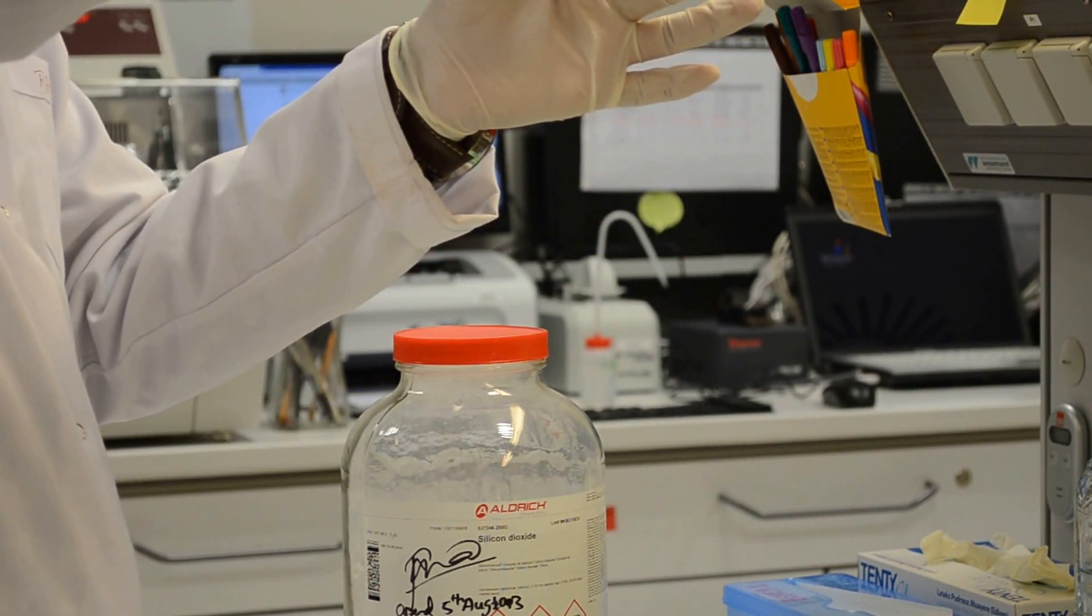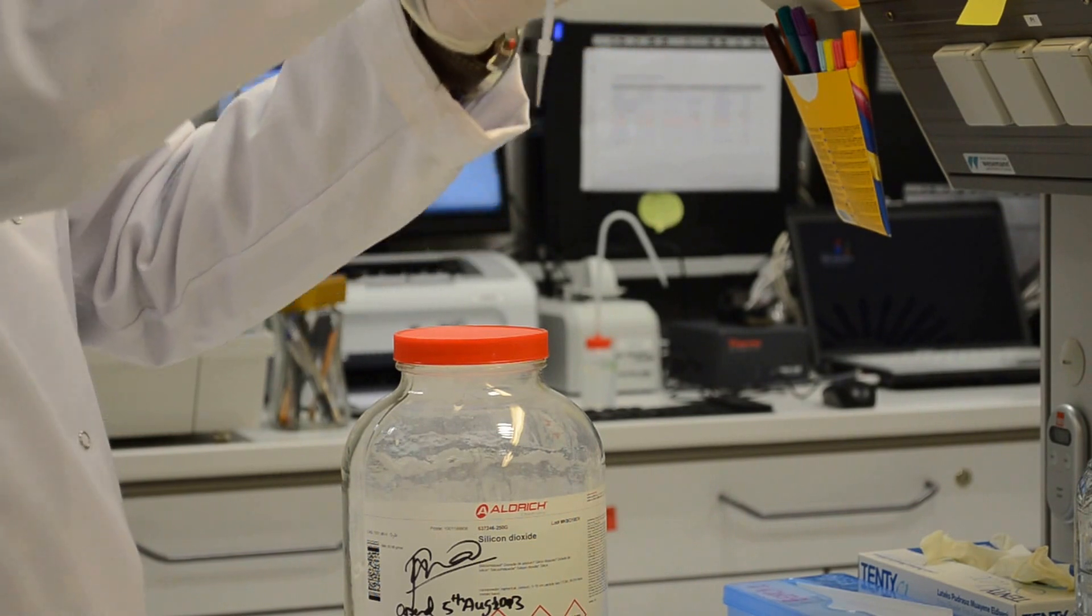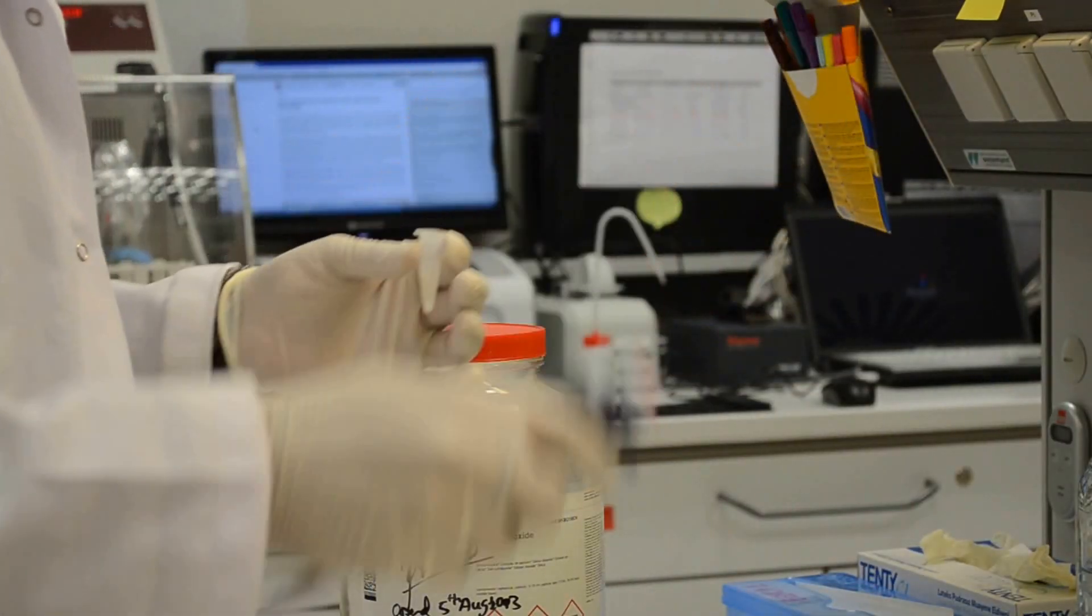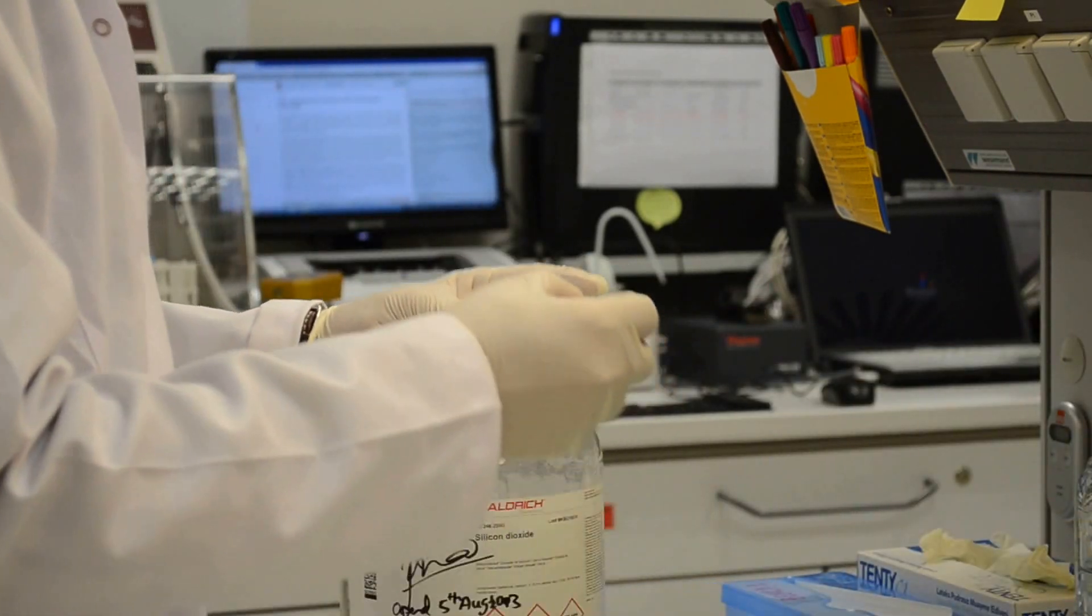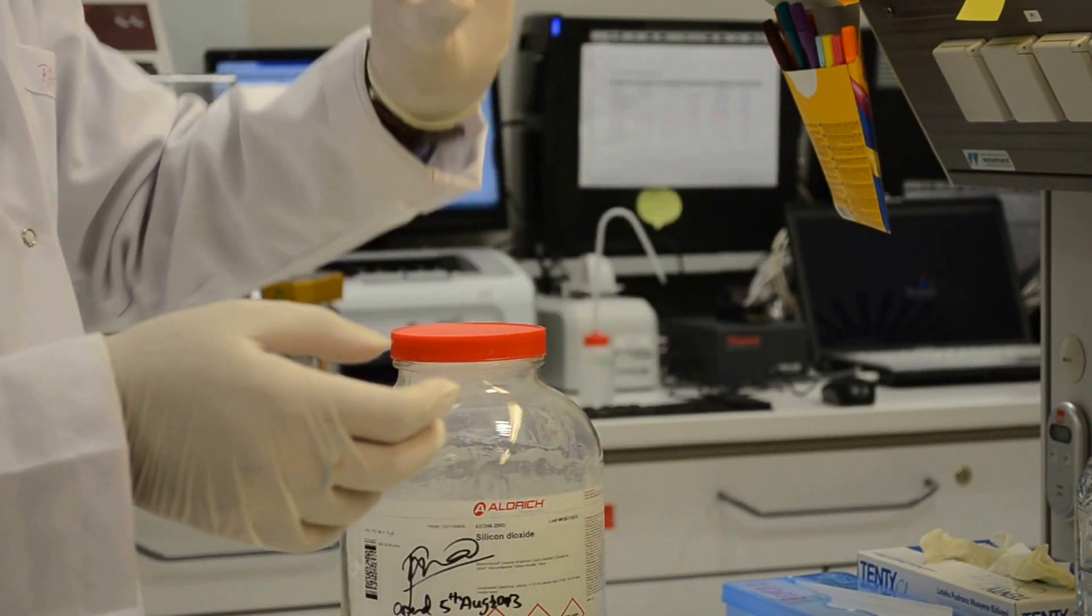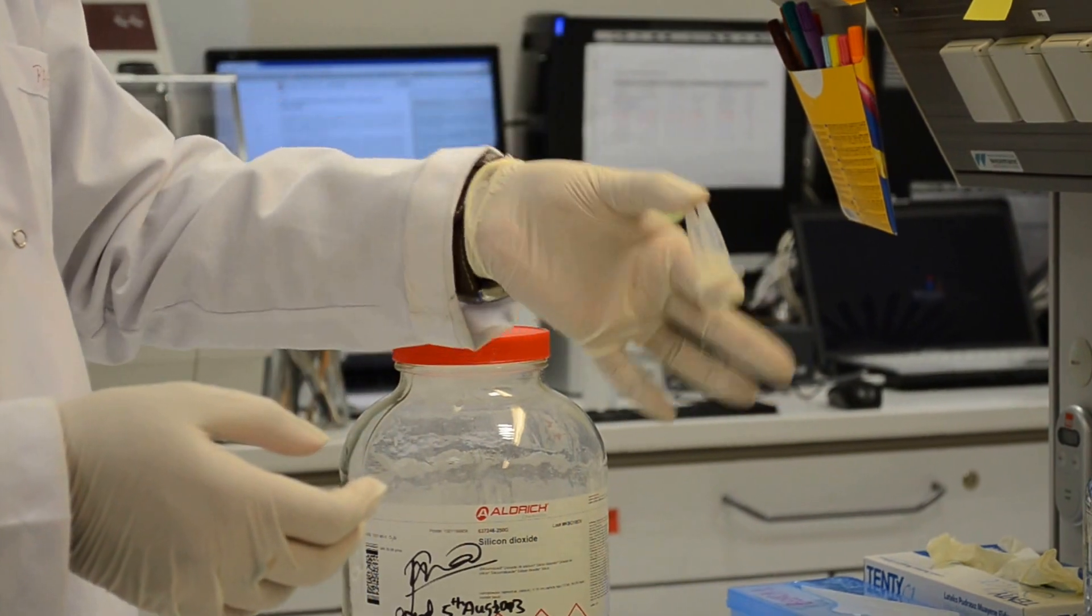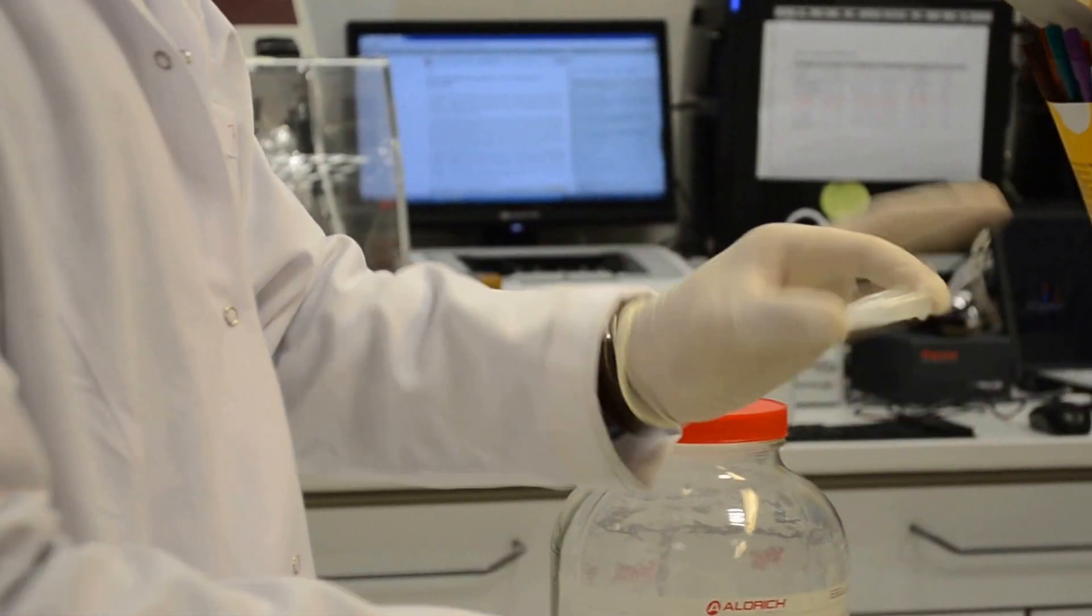We took two samples. One of them serves as control. This control sample will not be added with the reagent we developed. After mixing shortly, we will expose these samples into the UV light.